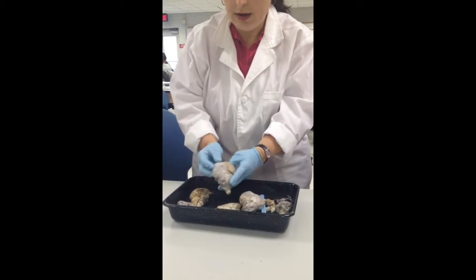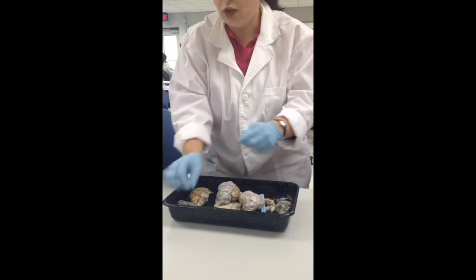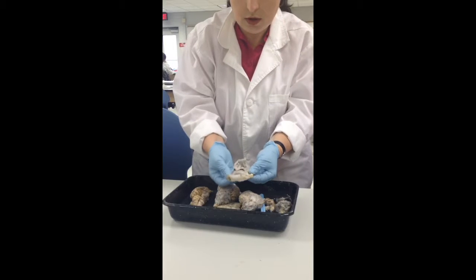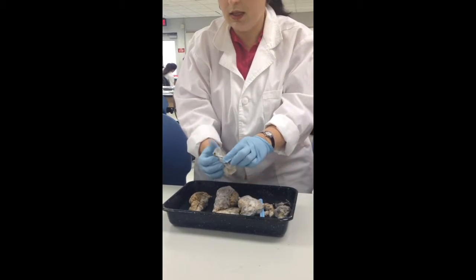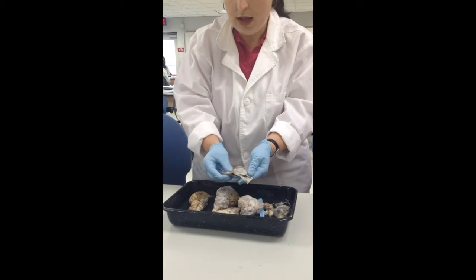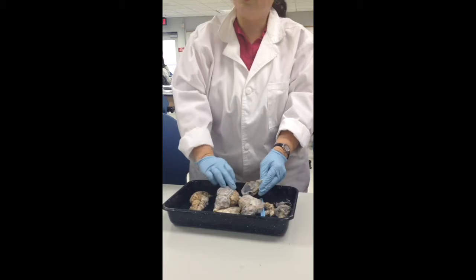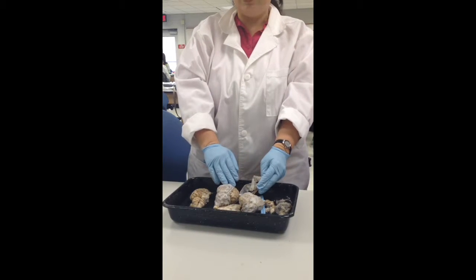Okay, all right, if I were to peel the meninges off of the longitudinal fissure, I would see a curvature like this. Okay, now in this groove that is fitting in there, you've got a blood vessel that is also draining the CSF. What blood vessel would that be?